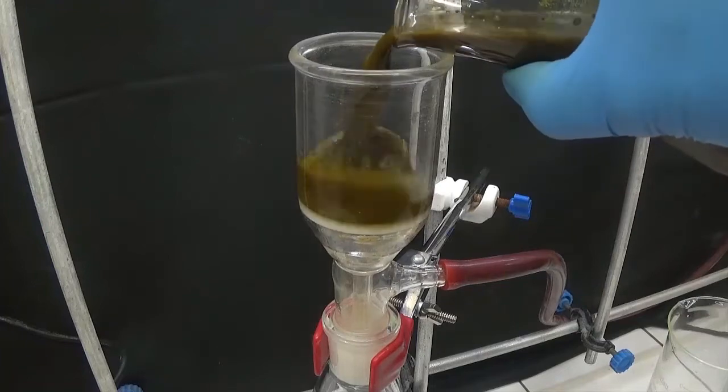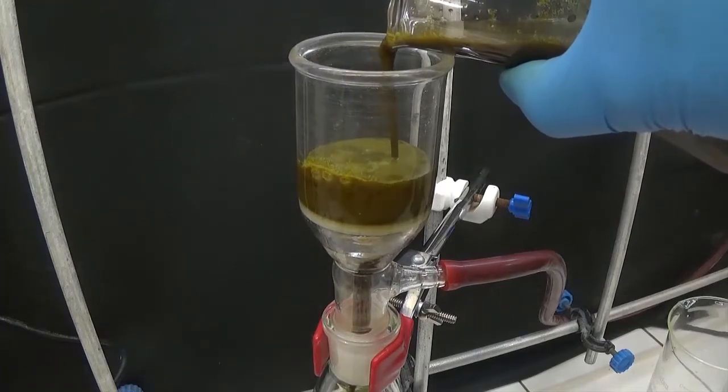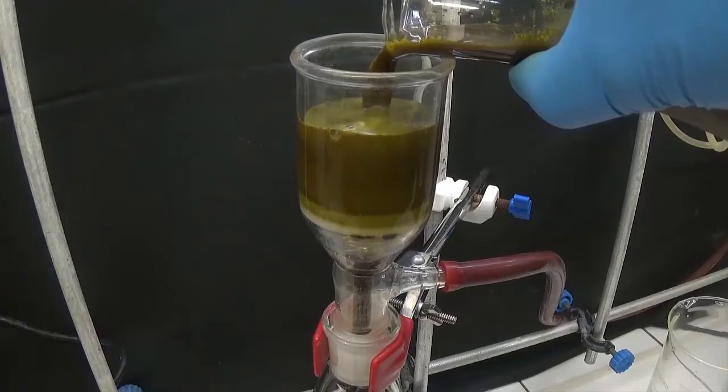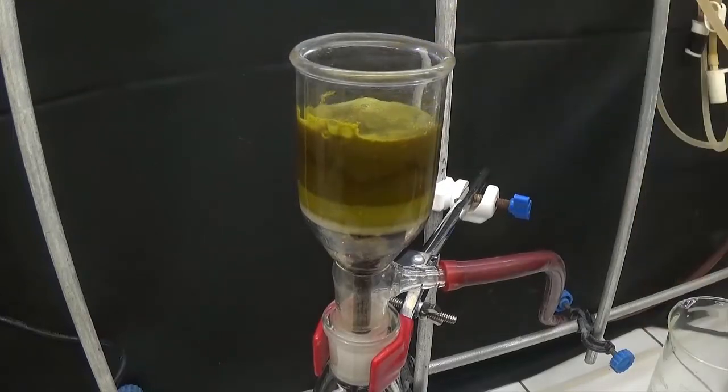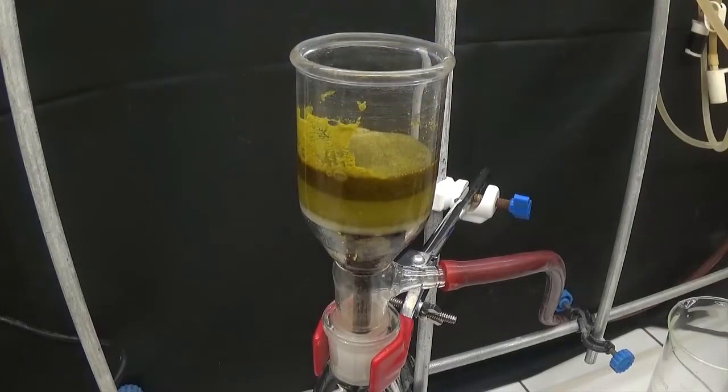Cool in the fridge and precipitate as much benzoquinone as possible. Collect the benzoquinone by suction and wash with a small amount of ice water.